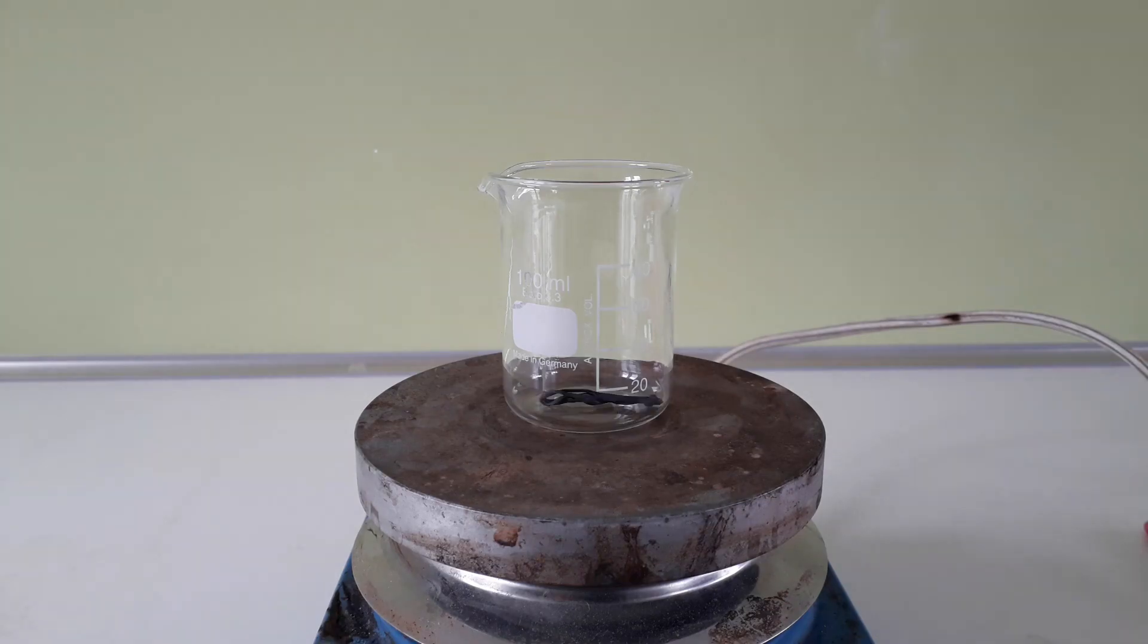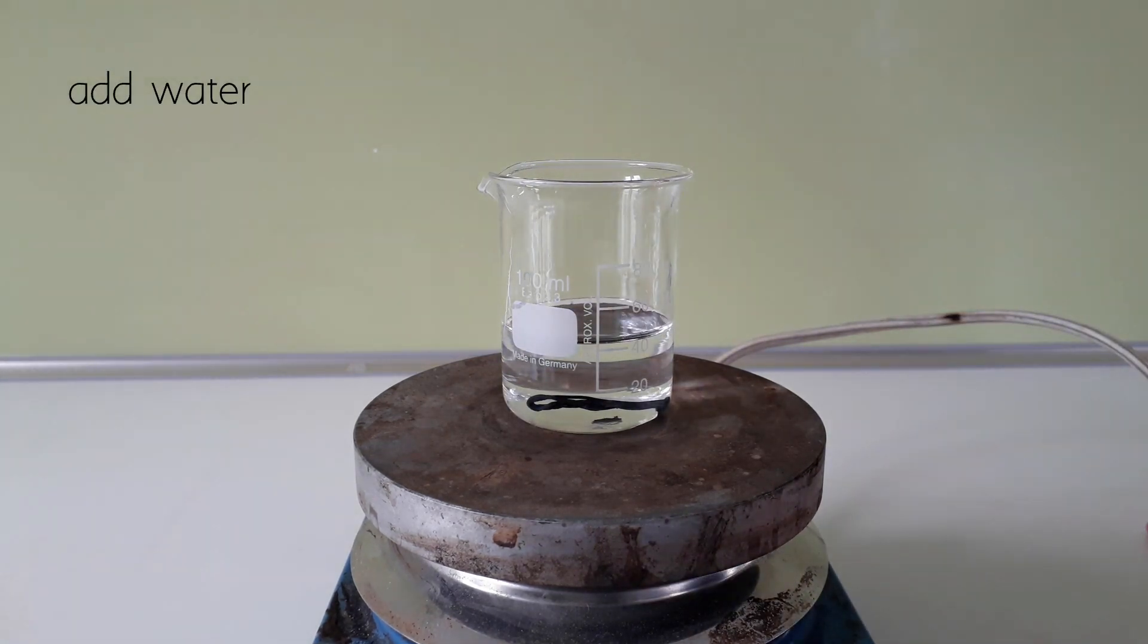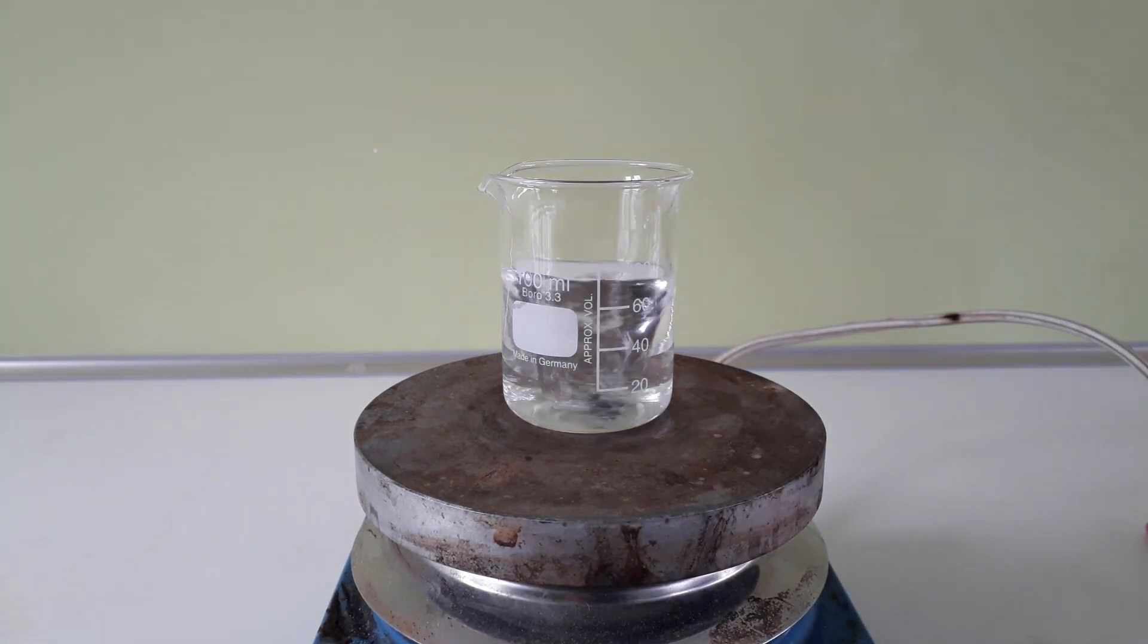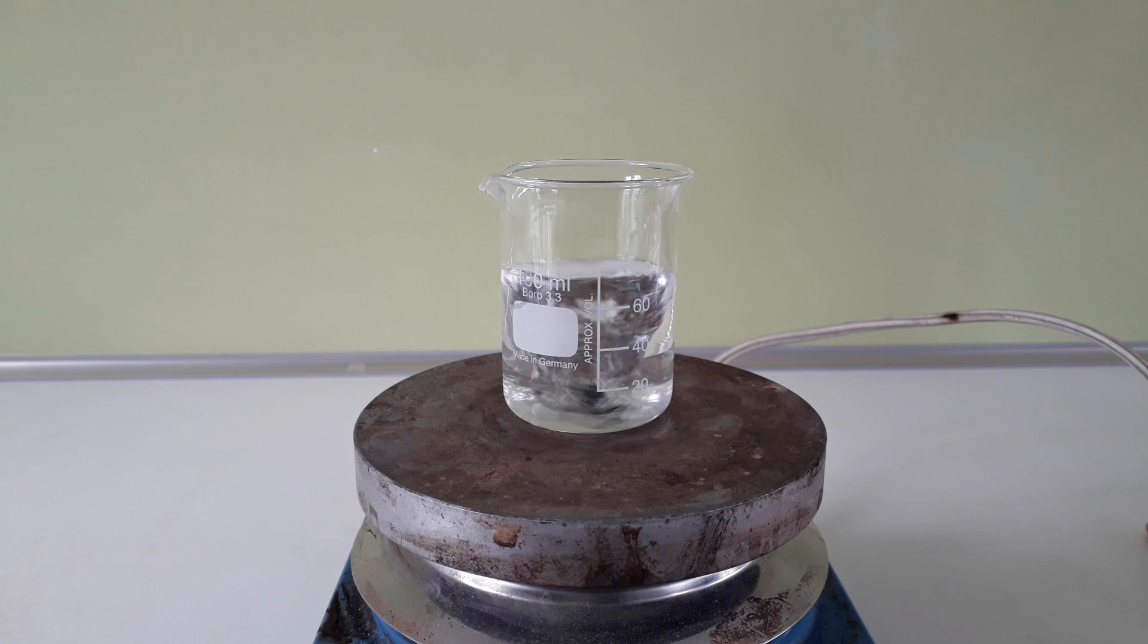As last thing for this video, I want to demonstrate why iodoform was used in hospitals, for example, in the 19th and early 20th century. It is the antimicrobial properties of iodoform. For this, I will prepare some agar cups to grow some bacteria.